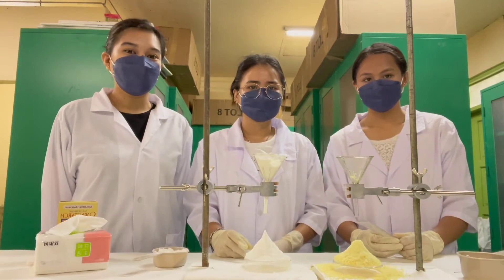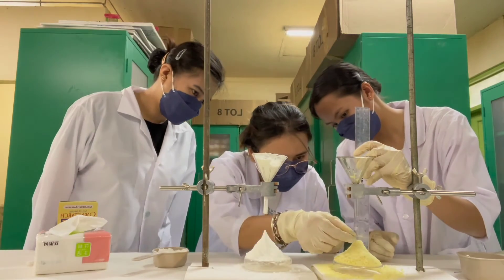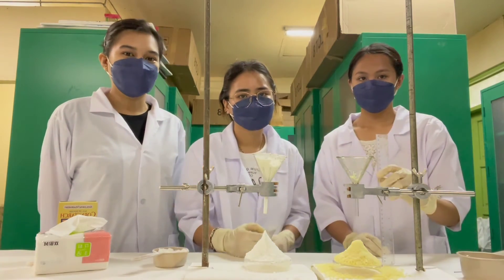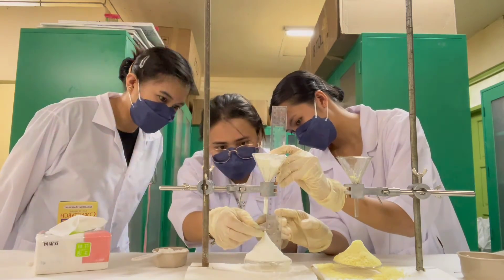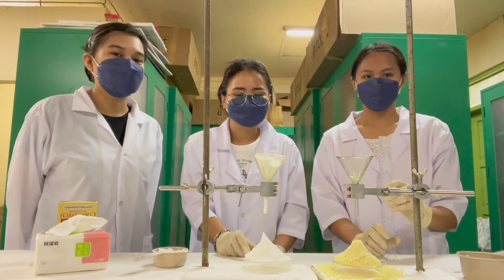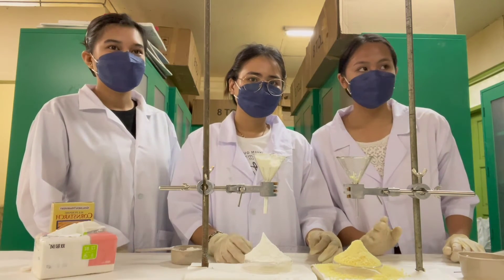For the third step we will measure the height of the two pyramids. For the starch pyramid it is measured as well.